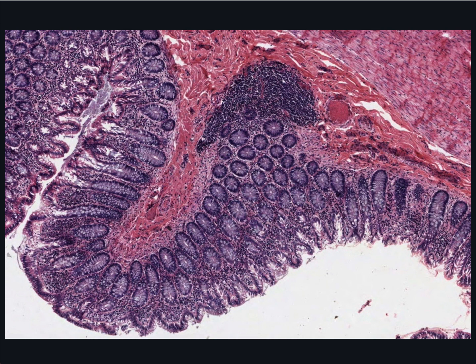Here is the lamina propria of the colon or large intestine, and this is the epithelium with cells lining the lumen surface that are absorbing mostly water. The epithelium has also invaginated into the lamina propria to form crypts containing mostly goblet cells. These crypts are shown here cut in cross-section with elements of the lamina propria in between the profiles of the cut crypts, and over here cut longitudinally.